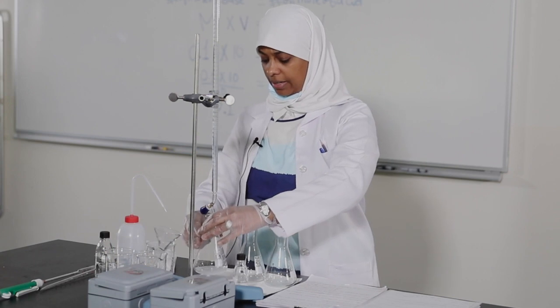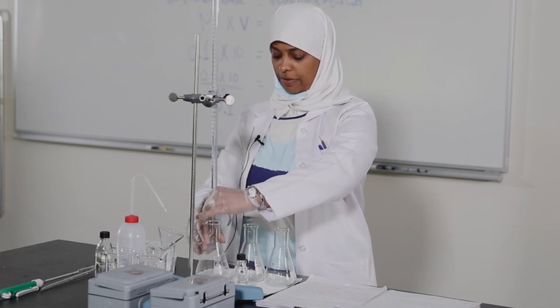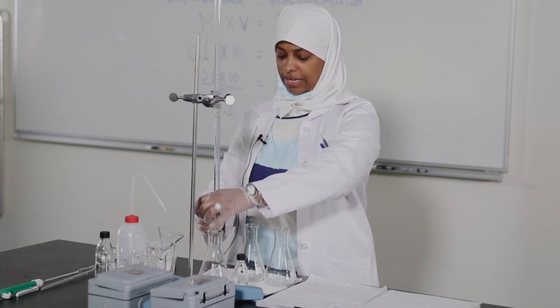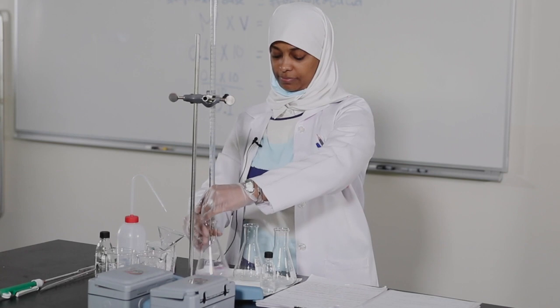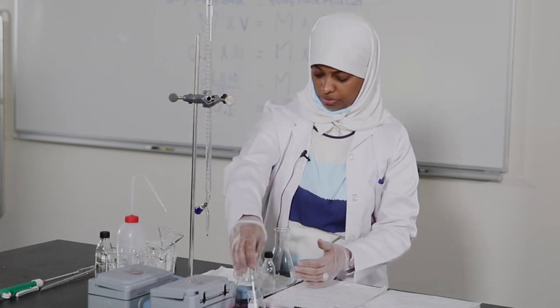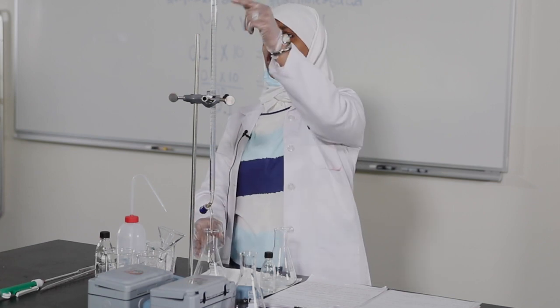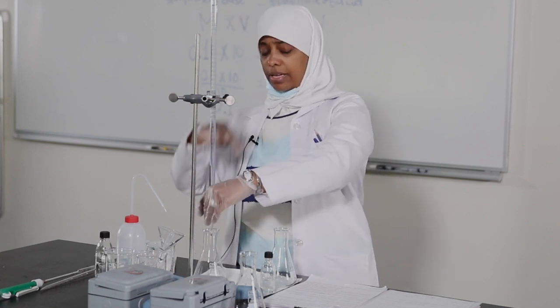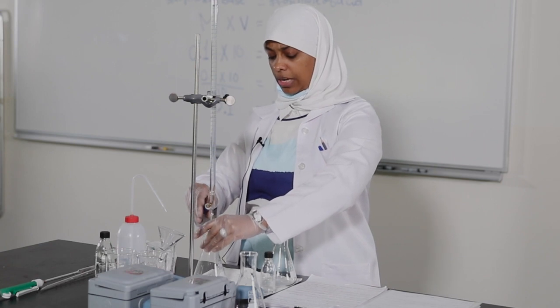When you run the titration, you will notice that the color change becomes visible. We count the drops carefully and continue the process. The second reading must stop at twenty, and we record it in the table.